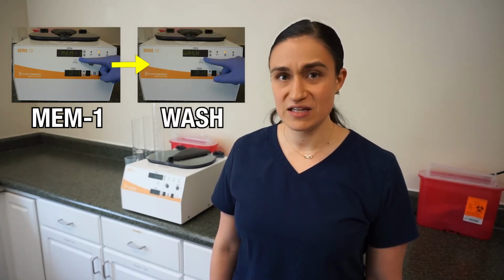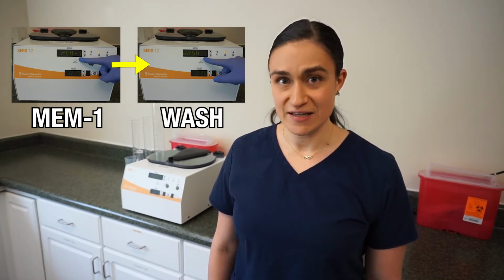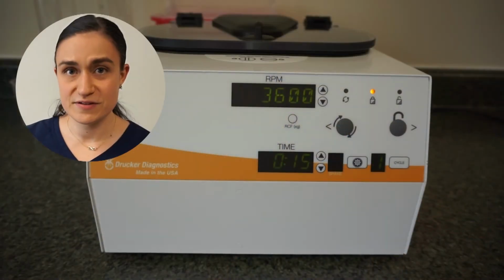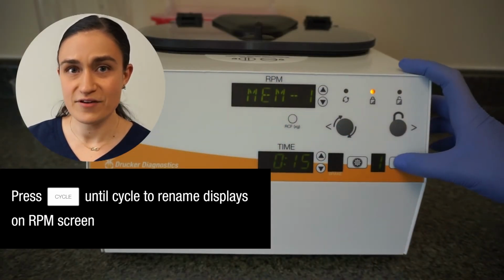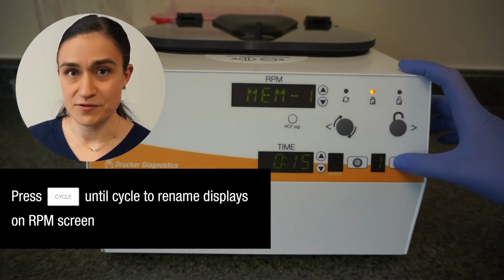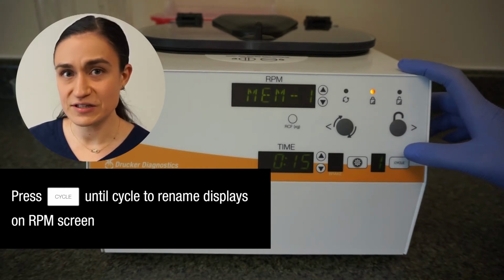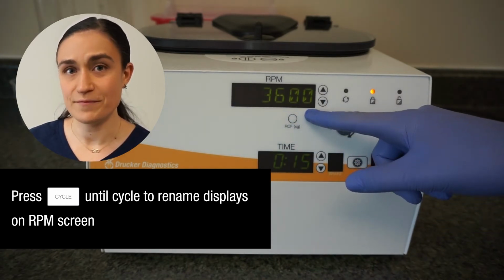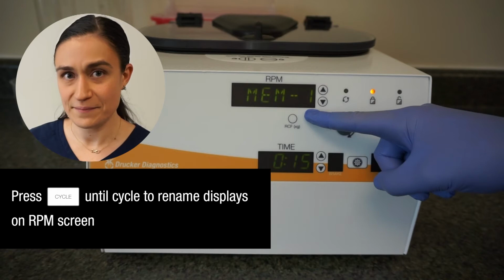We're going to be changing our cycle name from MEM1, which is what the default name is for any new preset, to Wash. But keep in mind, you can use this same process to change any cycle name to whatever you would like. We're going to start by using the Cycle button to navigate to the cycle that we want to rename. You can tell which cycle you've got selected because the name of that cycle will alternate with the RPM in the RPM screen.